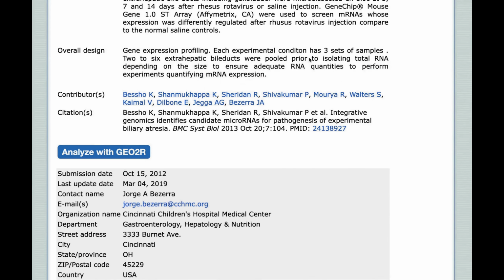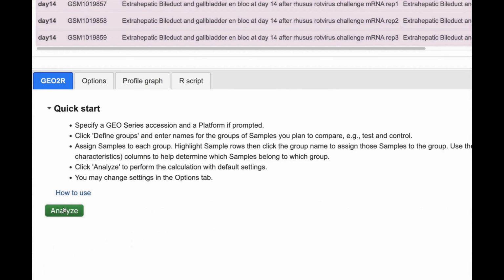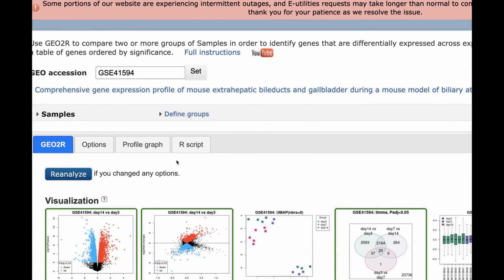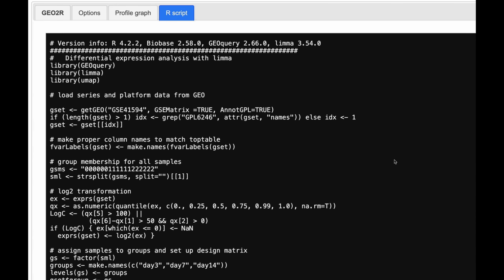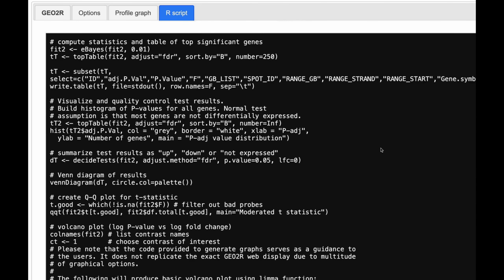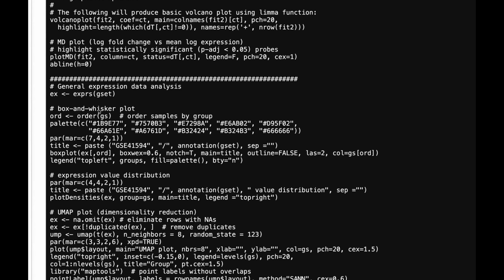Then secondly, you can do a bit of GEO2R analysis. You define groups, it doesn't matter much how you define them, and run the analysis. After it's done, you copy and paste the R script. The most important part is, of course, the beginning of it, where you will learn how to import data into your RStudio. It will be original scale data, but anyway. And then at the end, you might borrow some illustrations. The middle part will be considerably modified and changed according to the limma user's guide.